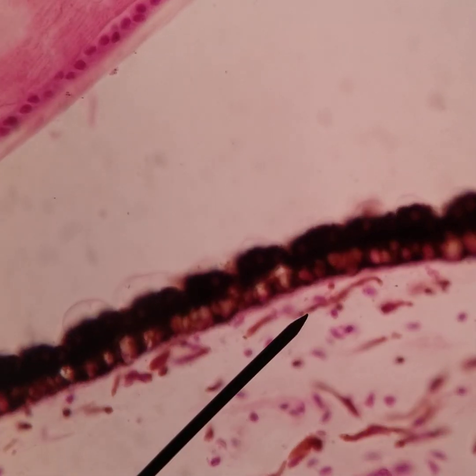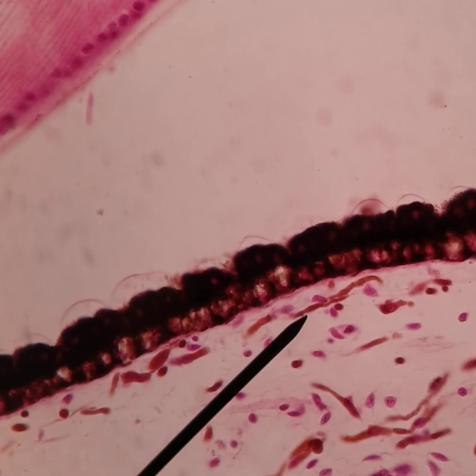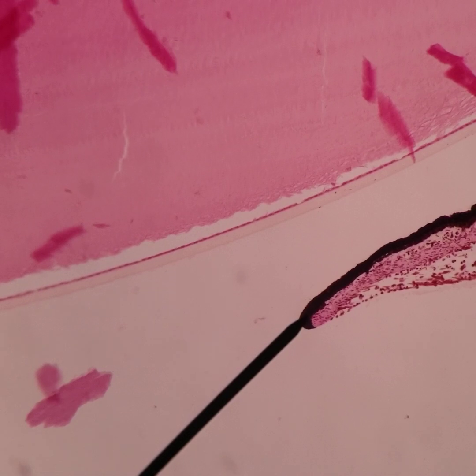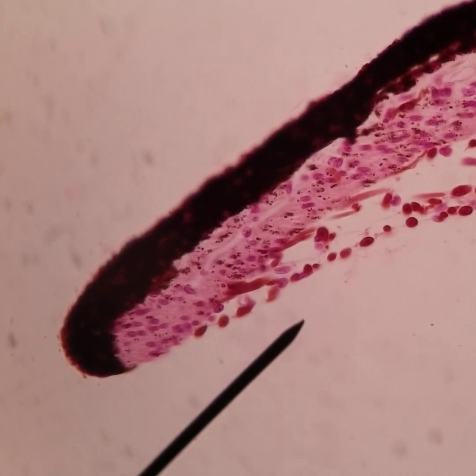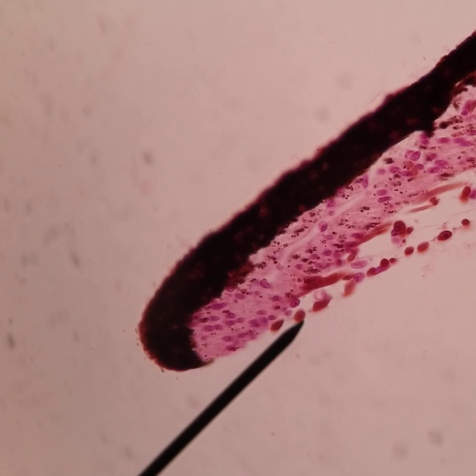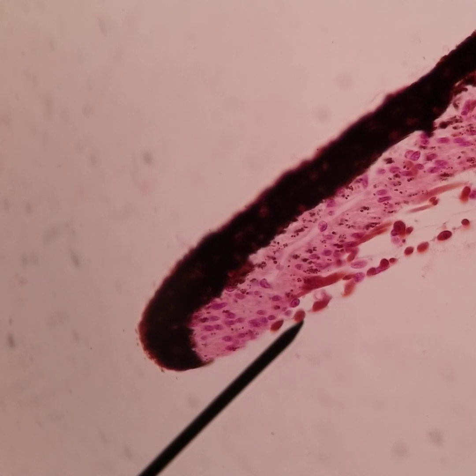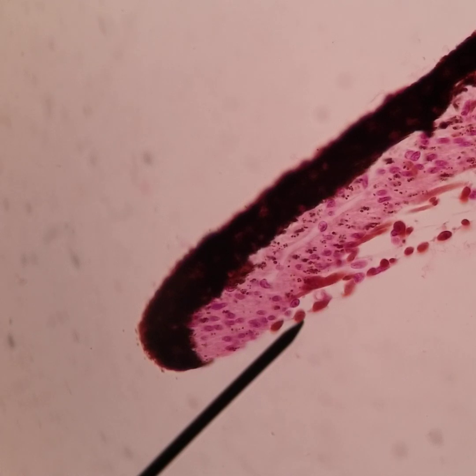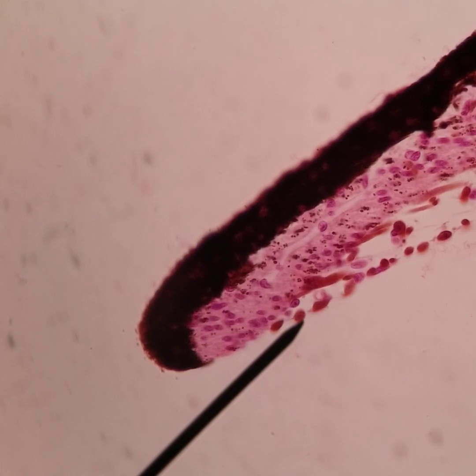Those are the main layers of the iris. At the pupillary margin we have the pupillary ruff, where the epithelium turns over and you have that physiological ectropion. You can actually see the pupillary ruff on your patients because it rolls a little bit anteriorly, showing the anterior and posterior epithelium of the iris at the pupil margin.